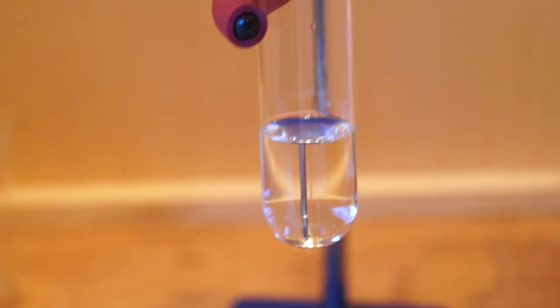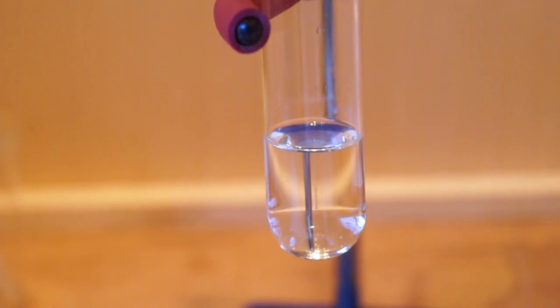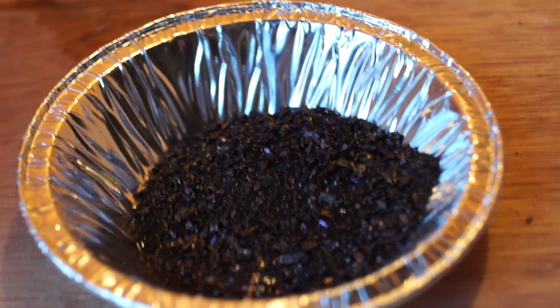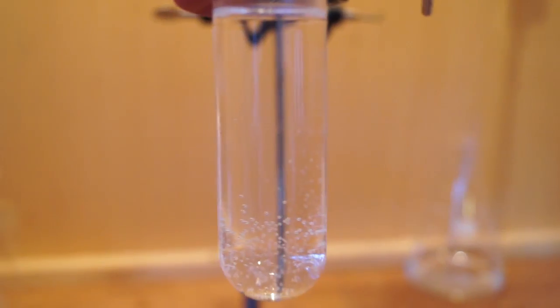I then added an equal amount of my alcohol to form a liquid suspension. For the reaction to be successful, the alcohol must be at least partially dissolved. I then added excess potassium permanganate to my alcohol-base mixture.